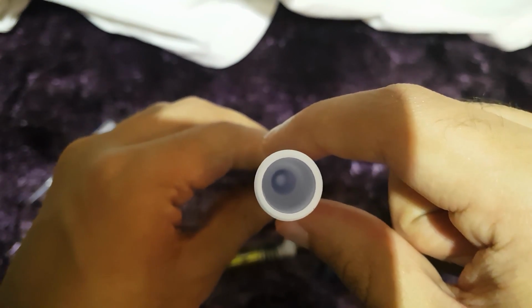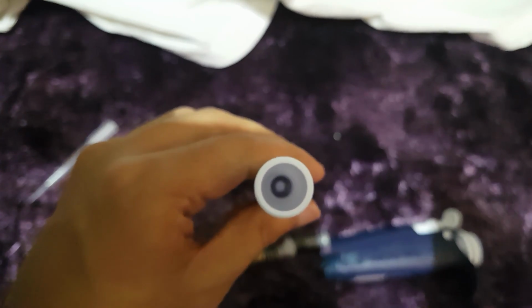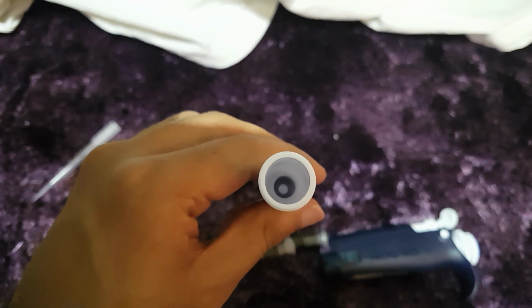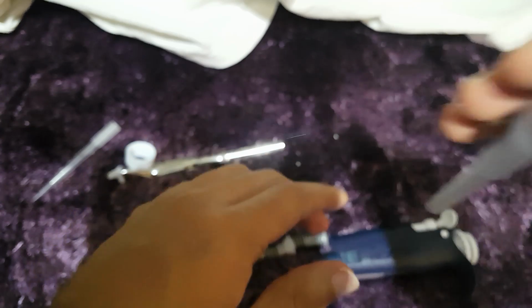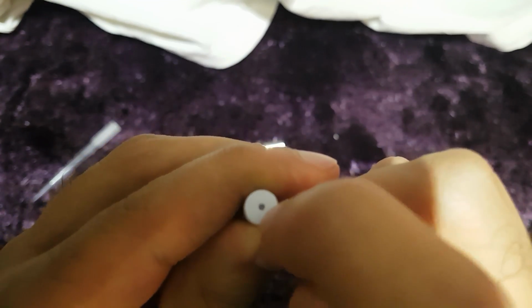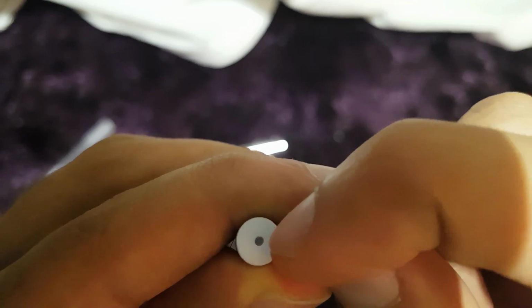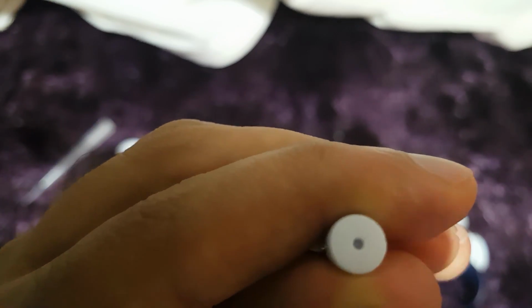So what I'm going to do is I'm just simply going to blow some air through this. Not with my mouth, but with something you can blow air with. So just give me a moment whilst I blow some air through this. I was unable to blow air through this, so it means that there's something blocked in there. So what we have to do is we have to try and unblock that, as you can see there, actually.